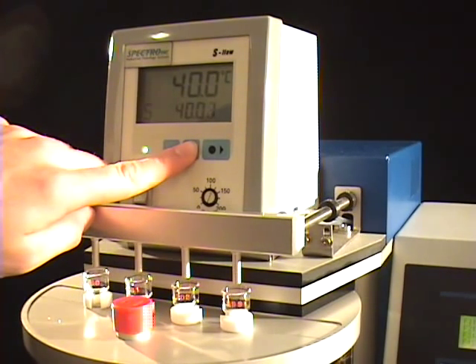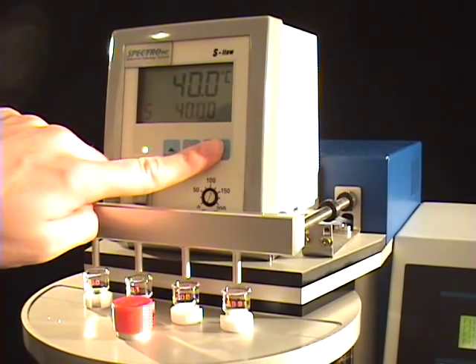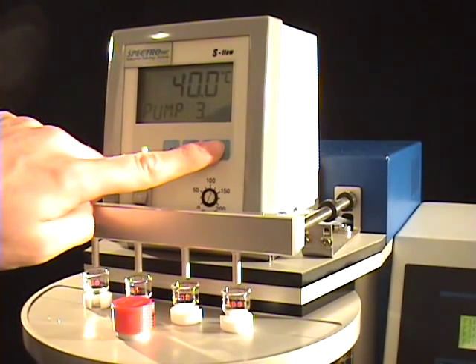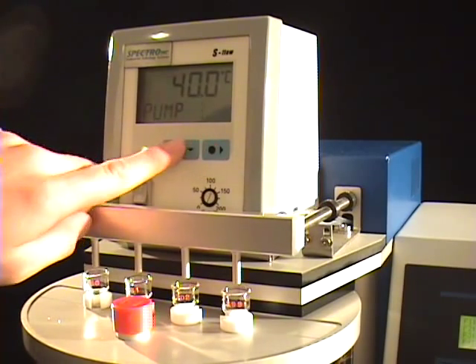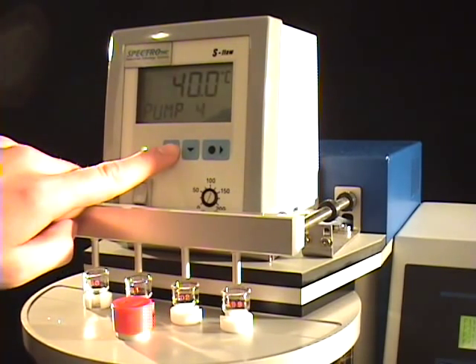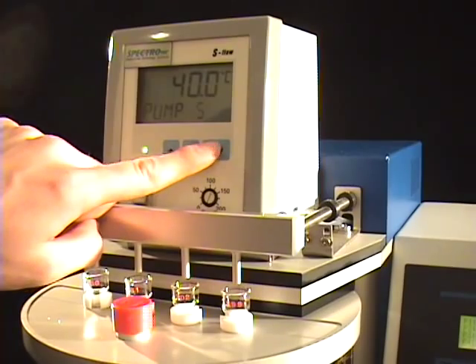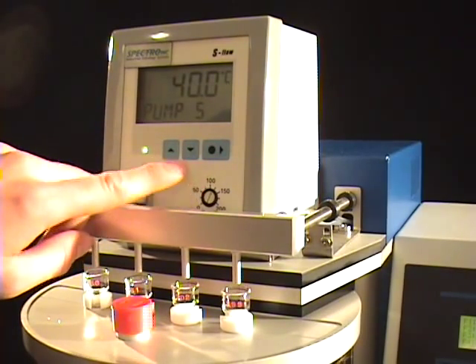The pumping speed of the thermostat can also be changed. At lower temperatures, a higher pumping speed is required to ensure good heat dissipation. At higher temperatures, the pumping speed can be lowered. Press the program button twice and change the pumping speed as shown here.